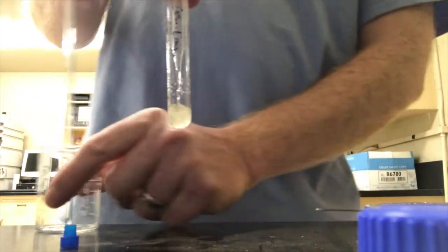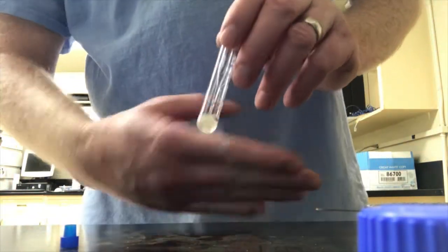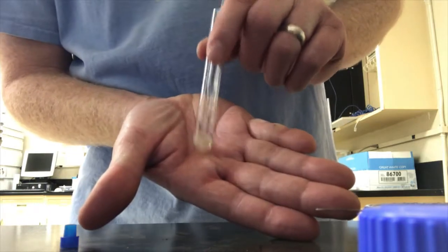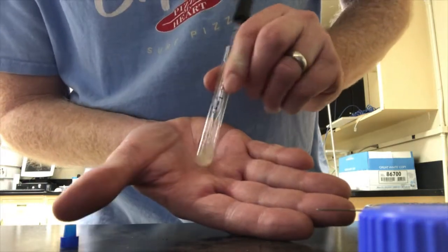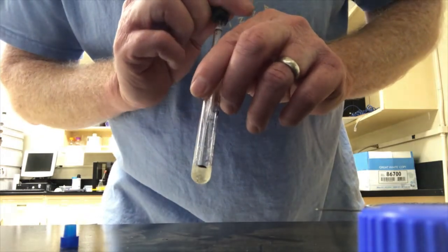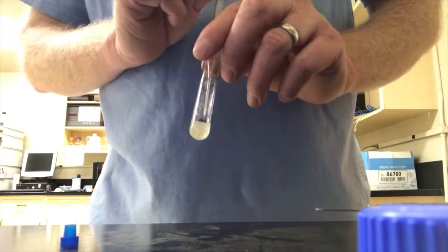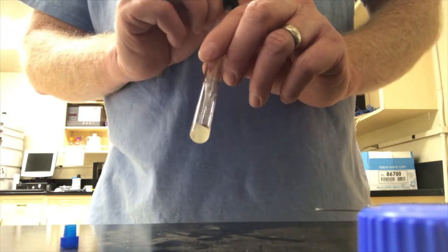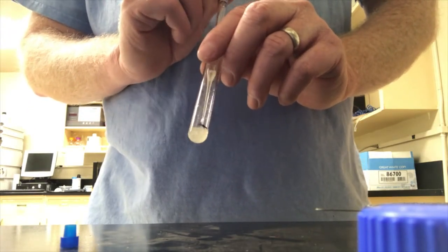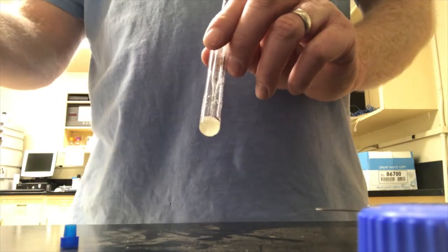Another thing about deuterated DMSO, it dissolves things very well, organics very well, and it's also kind of slow to dissolve them sometimes. So with other solvents, if something's soluble in them, they just dissolve right away. But with deuterated DMSO, occasionally it'll take a little while for it to dissolve. You have to give it a minute, and it'll dissolve more than you expected after a minute or so of giving it time.